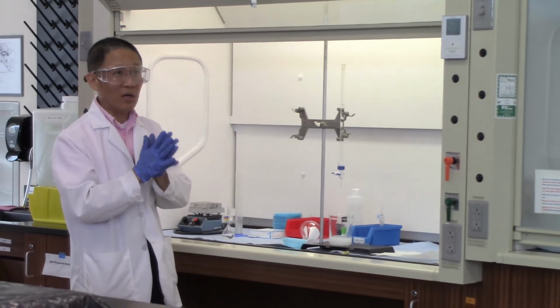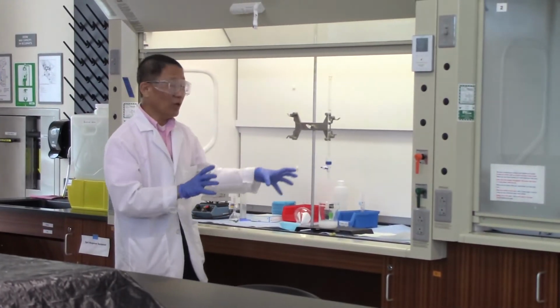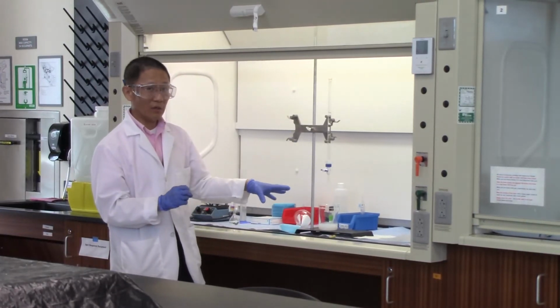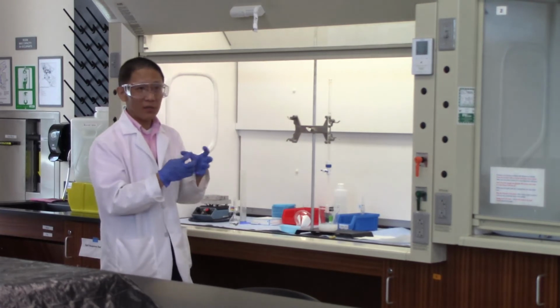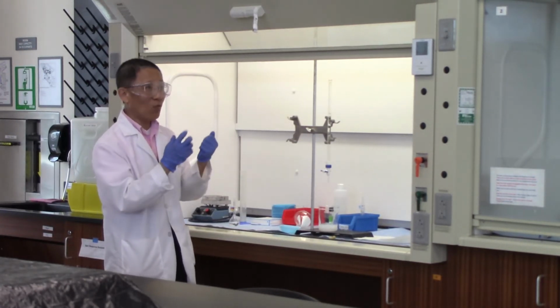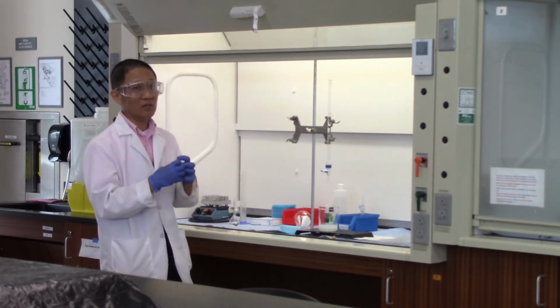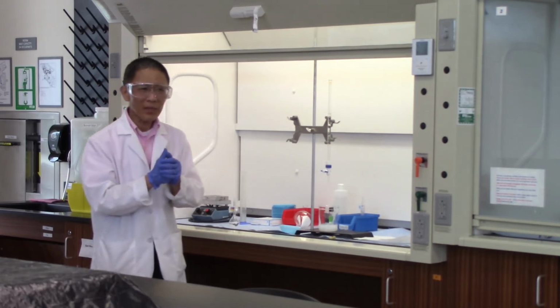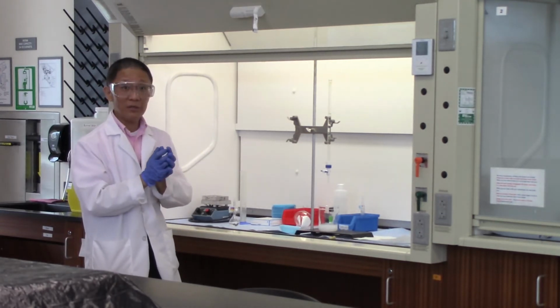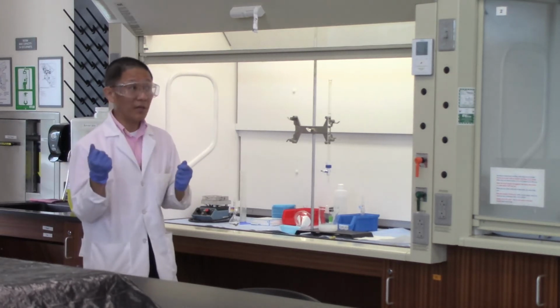One of the things that we talked about in the pre-lab is that we want you to understand the process of digestion. The lab manual asks you to add the barium chloride slowly into the beaker, forming that white solid. Once you finish adding, we want you to slowly cool down the hot solution. The lab manual even asks you to use cotton or glass wool to wrap up the beaker so that you can cool it down slowly. That is the process that we call digestion.